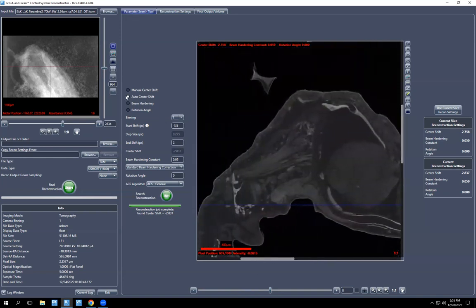You can do it again. You can do it manually. And the manual part of it is you choose the step size. So this auto one has a set number of slices that it'll do. So whenever you change your start and end, it'll change the step size based on, I think, however many it does. Is it 14, I guess? But on manual, you could do these numbers and say you want a step size of this value, and you'll have a lot more than 14.